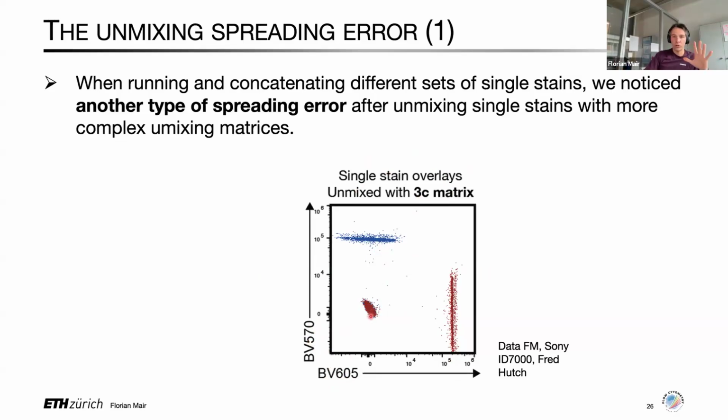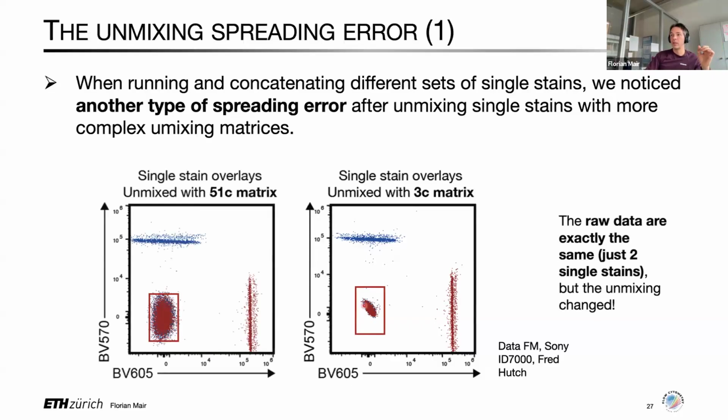Turns out when you take the exact same raw data, which are just the 2 concatenated single stains, you don't change anything about the raw data, but you just change the unmixing matrix, meaning you have more spectral signatures in the unmixing matrix. When you apply that more complex unmixing matrix to exactly the same raw data, things look like this. So you can see that the negatives show a drastically increased variance or noise or spread, depends on how you want to call it.